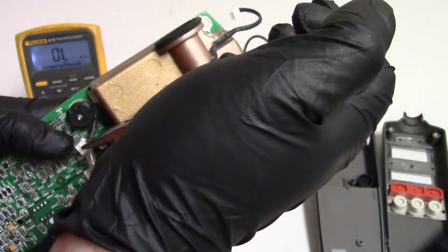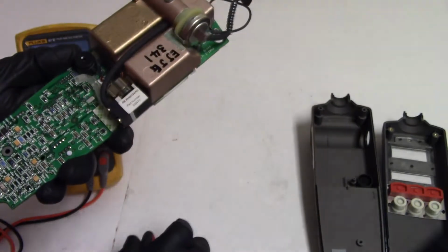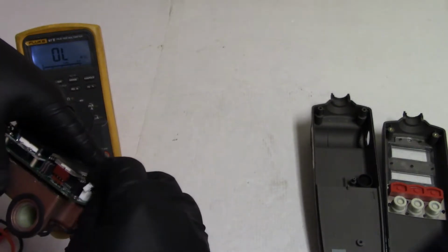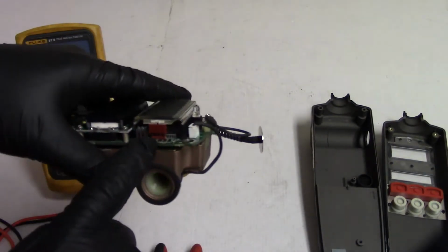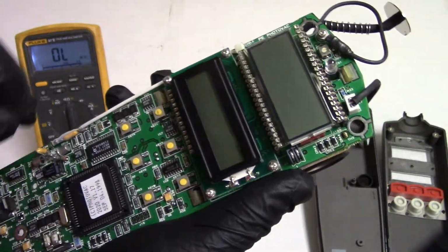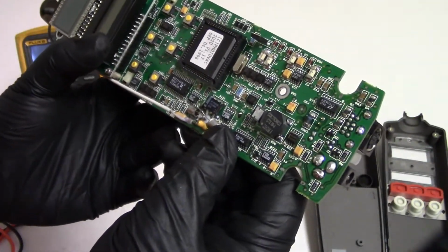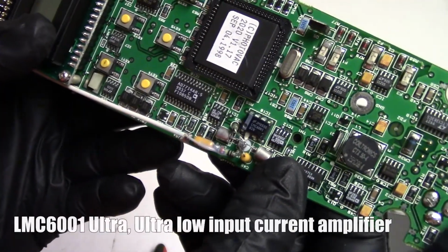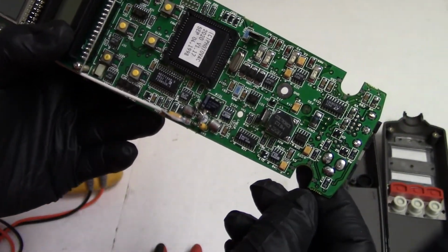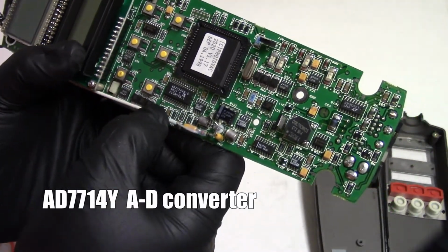And there's a whole bunch of electronics. I know what all the electronics do by themselves, but I'm not really sure which circuit is which. There's a microcontroller under this display, which is probably just for driving the display. This is probably doing everything. I expect most of it's being done through this. That's an LMC6001, and I'll put up on the screen what that is. It's probably an op amp of some sort, instrumentation amp maybe, and that's probably an A to D converter, I'm guessing.